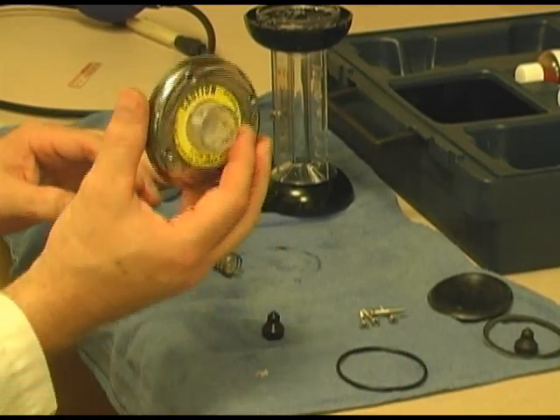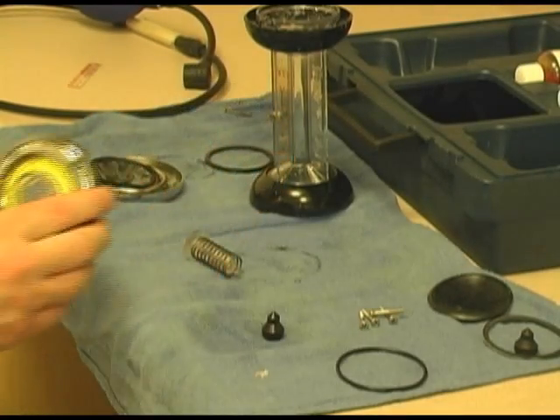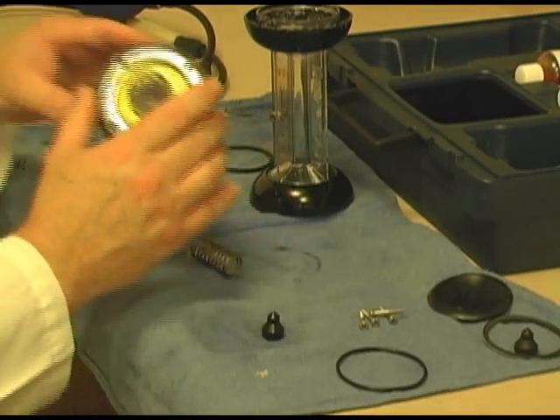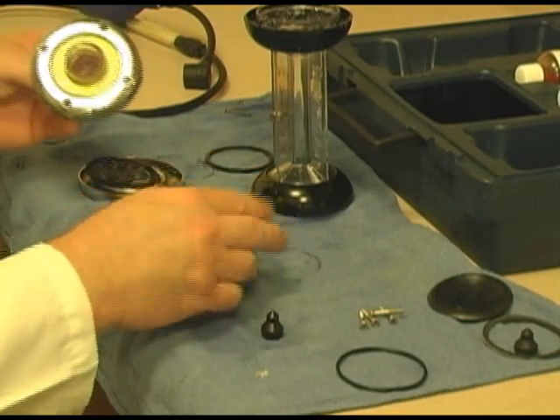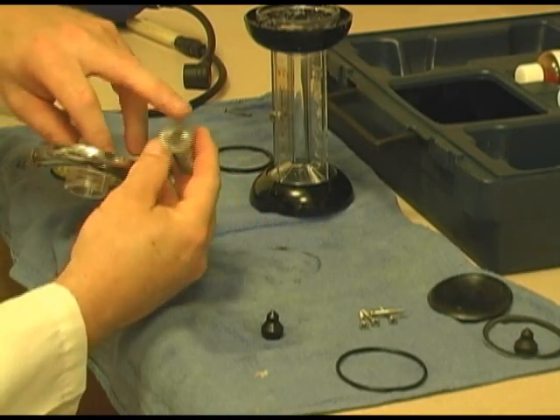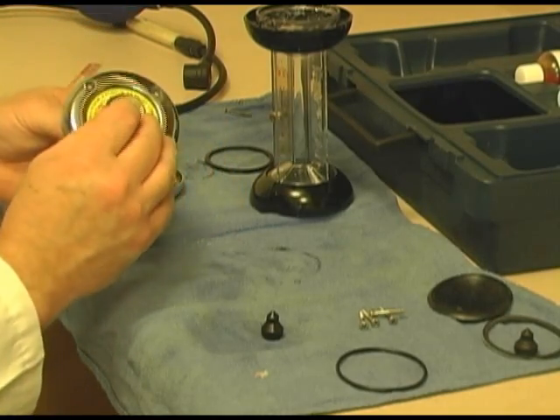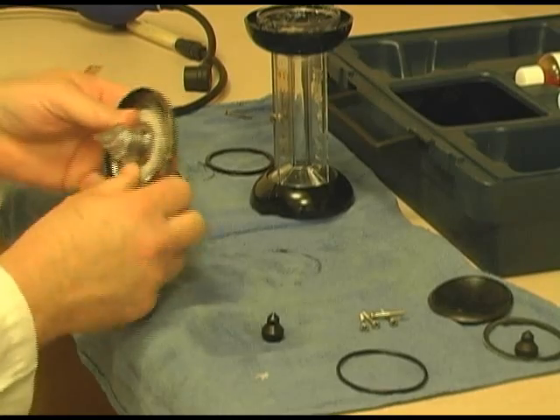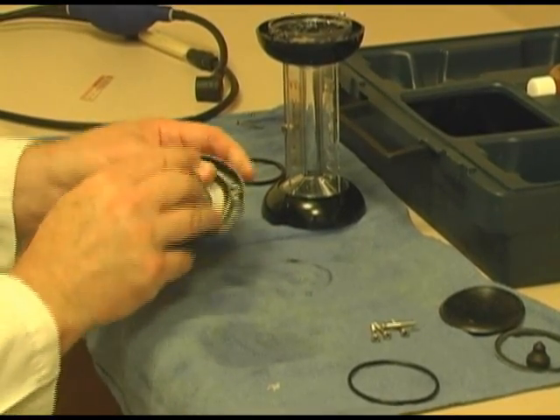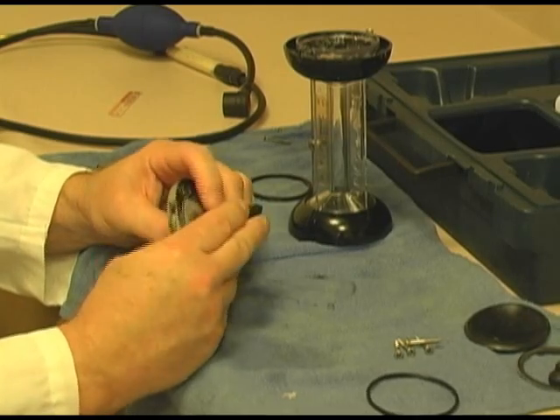And you can still see the salt inside of the top lid. Now that this is cleaned up a little, we'll reassemble it. First, I will tell you that a lot of times you'll see little cracks and so forth around this end piece. As long as it doesn't leak, it's not a problem. Throw that back on. Put in my top.